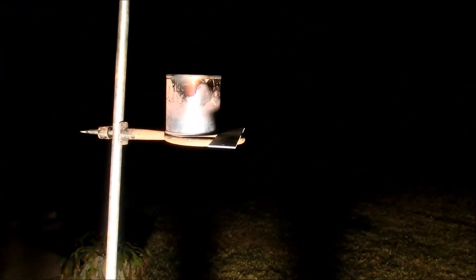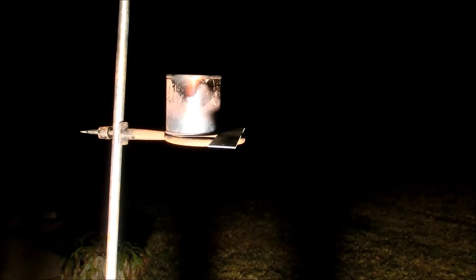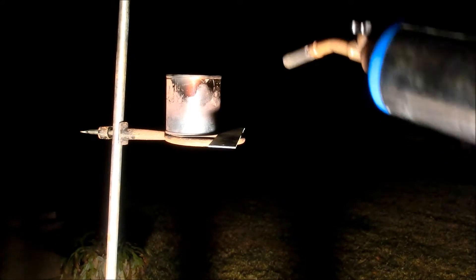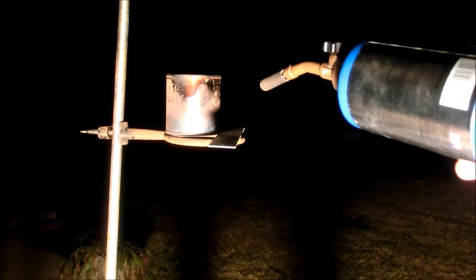So I've taken my can outside and set it up on this ring stand so that I could heat the bottom of the can. One thing I failed to mention is I like to compress the mixture into the bottom of the can so that it's a nice solid puck. And now I'm just going to light the torch and heat the bottom of this can.